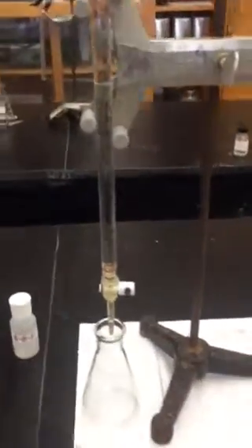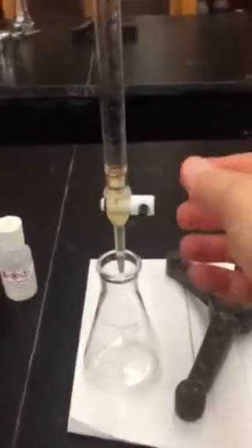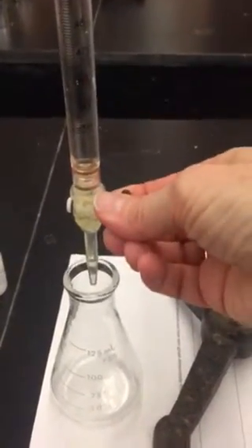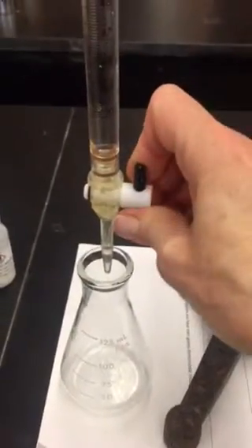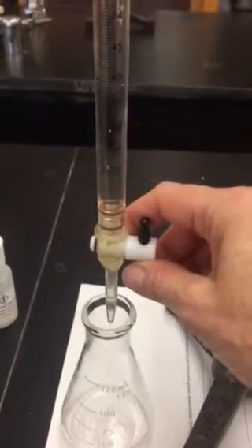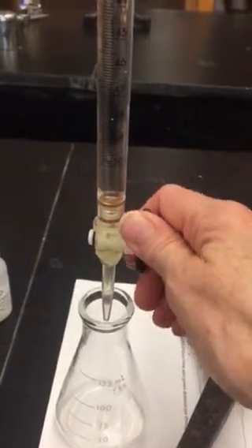You might need to practice that between you and your partner. Read both the acid and the base, and record those as your initial volumes. Then you come down here — right now the stopcock is perpendicular to the burette. When I turn it so that it is parallel to the burette, that's going to release some of the acid, and I'm going to watch the top so that I empty just about 10 milliliters.